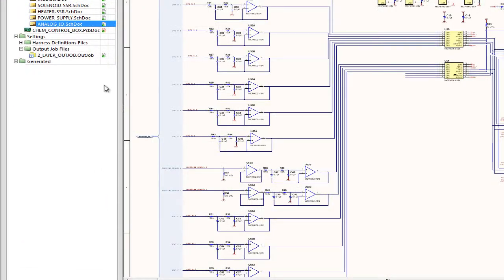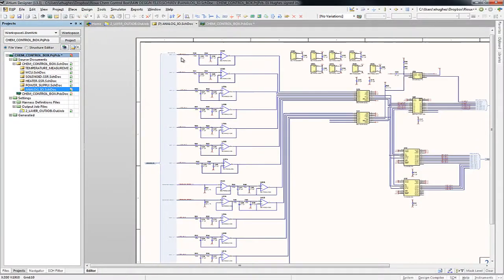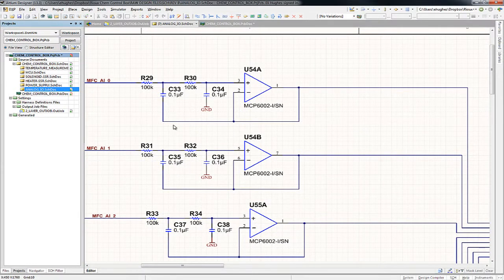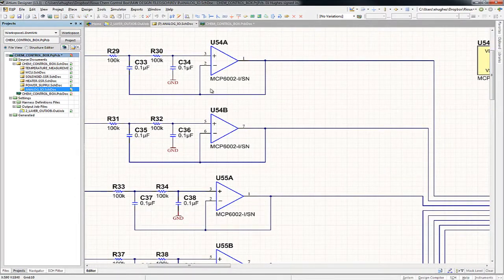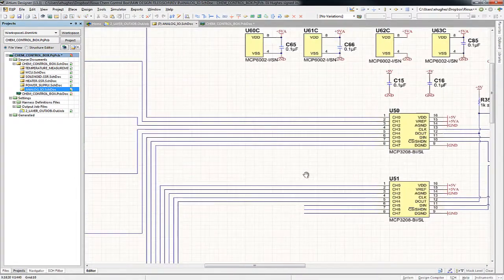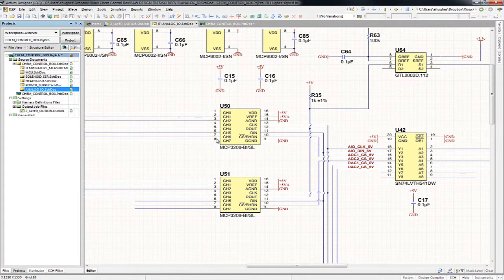The analog I/O provides all of the A to D converters for the mass flow controller inputs and the general purpose analog inputs. All of the channels have what's called a Sallen-Key input filter to filter out high frequencies and smooth out the signal. And all the signals come in through these A to D converter chips. Now, you don't need to know a whole lot about these A to D converter chips. There is a driver within the source code I'm going to provide that does all the magic. You're just going to say read channel, and it's going to give you the data in volts.